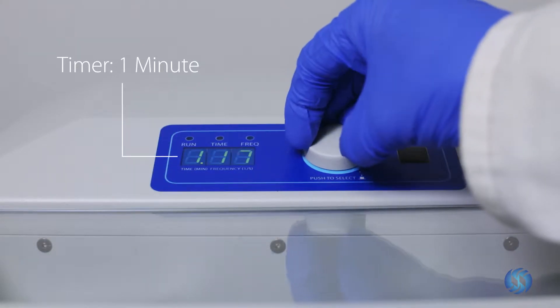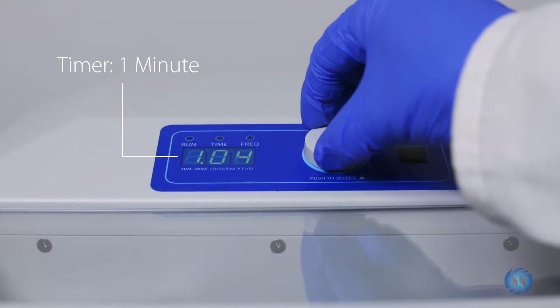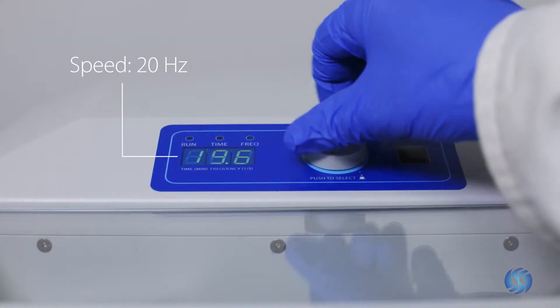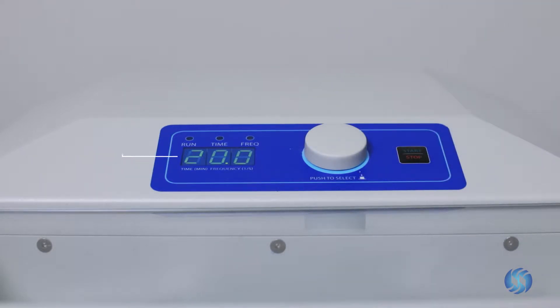Set the timer for one minute. Set the speed control to 20 hertz. Press the start button to begin the processing cycle.